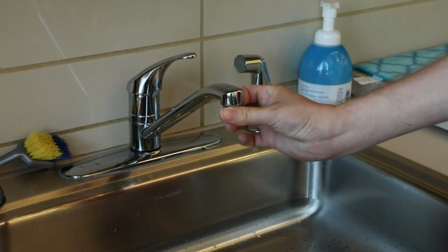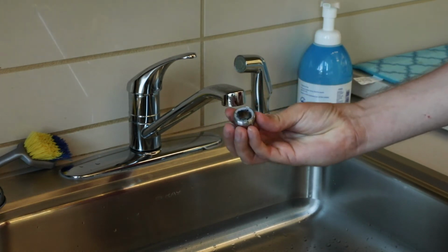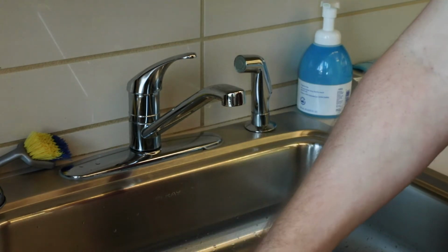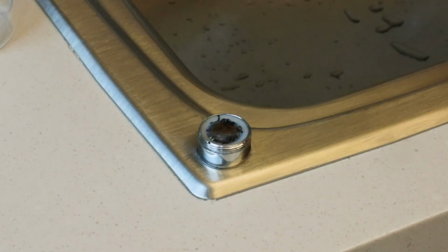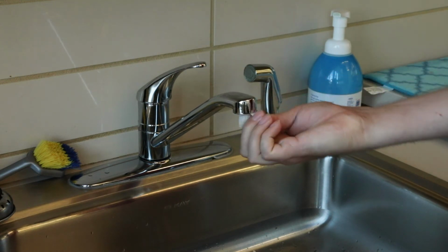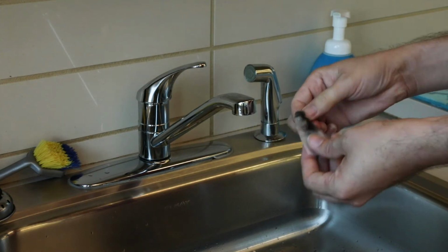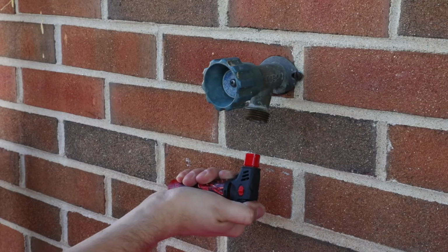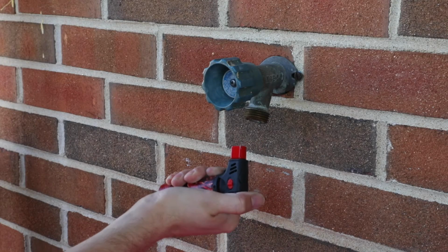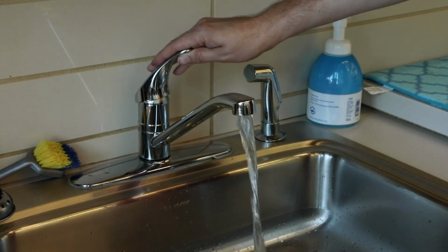Before sampling, it's important to remove any treatment devices that are found on the tap in order to eliminate any chances of false positive tests, as these devices may harbor bacteria. Make sure to follow the sample instructions for each test. You will want to properly sanitize your tap with either rubbing alcohol, chlorine bleach, or a lighter. Immediately flush the tap at high flow for 5 minutes in order to remove any stagnant water.